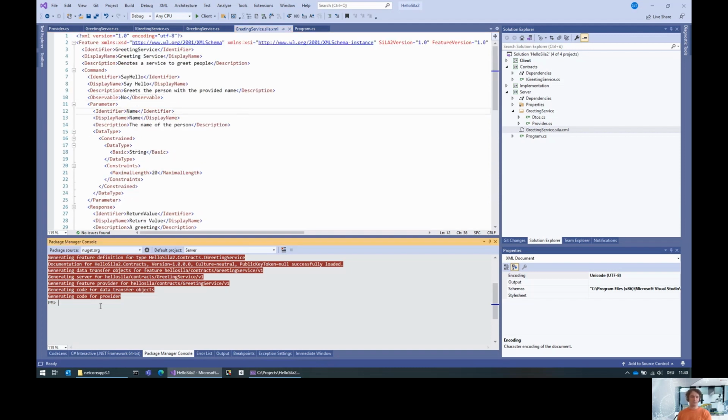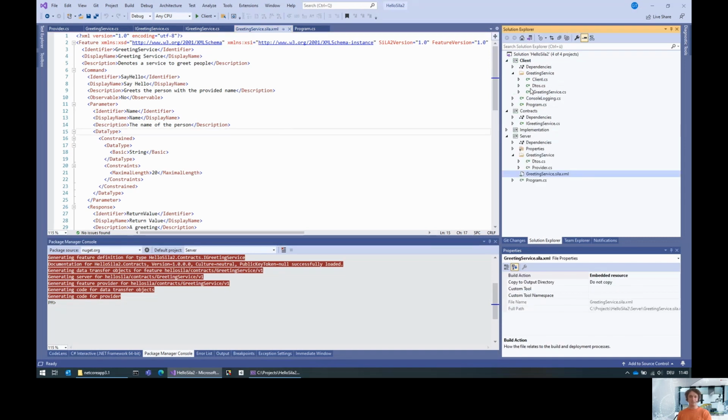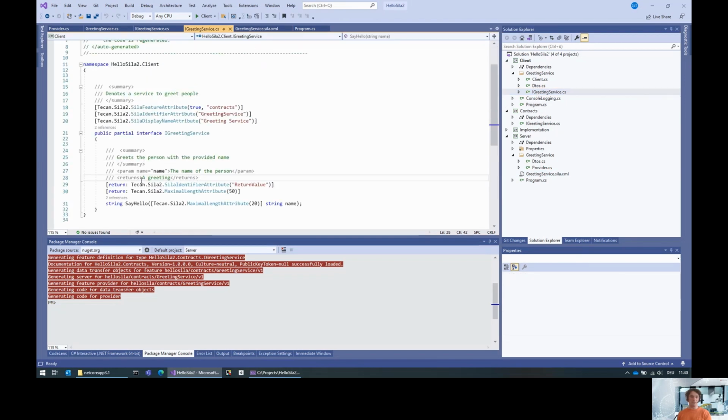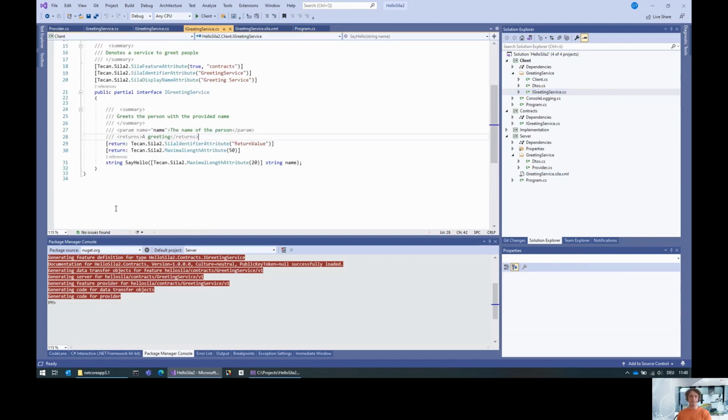Cool. So we have that on the server, but the client doesn't know about it. In the interface that's been generated, the exception information is missing. So what should we do? We again use SiLAgen, because the client was generated at the time that the exception was not there yet. So what we need to do is regenerate the client code.